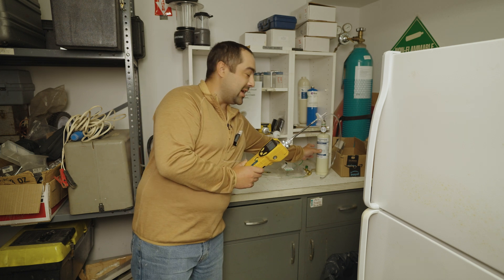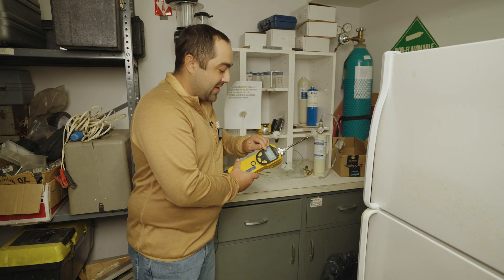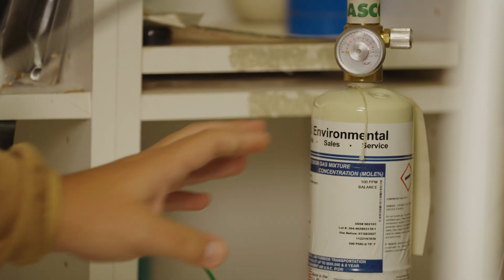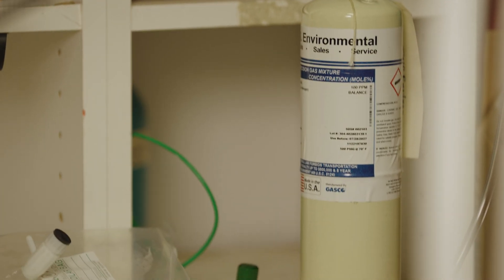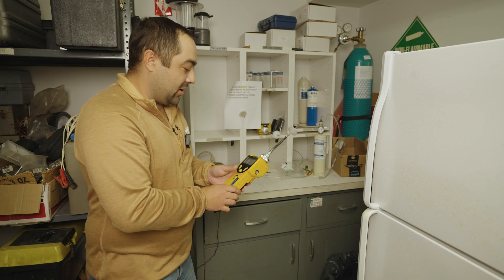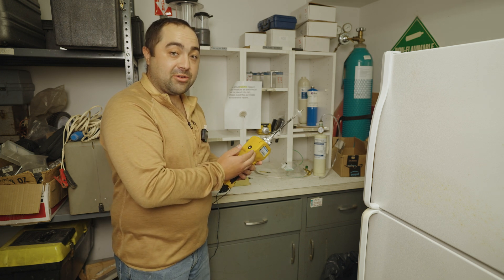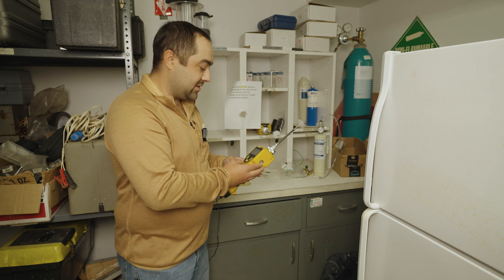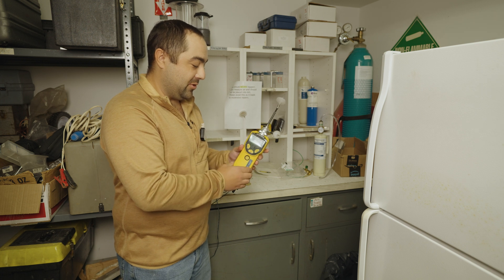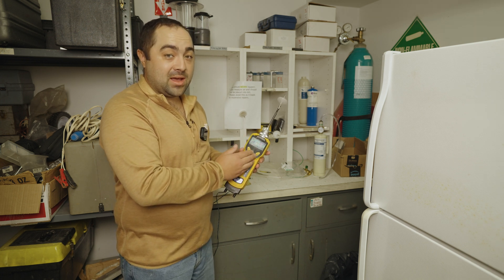It's calibrated with isobutylene gas. If you change your correction factor on here, you may have to change your calibration gas as well — that's something you can contact your supplier to go over. You can also change the voltage on the lamp in here to increase the sensitivity. This is a 10.6 electron volt lamp and you can change that to an 11.5 or 11.7 lamp depending on what you're reading for and how sensitive you want to get.